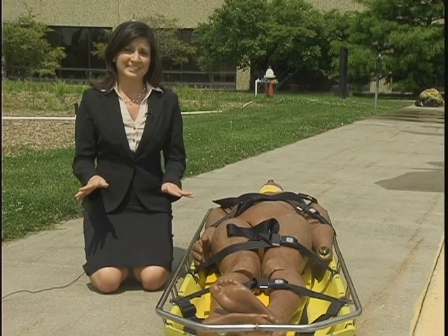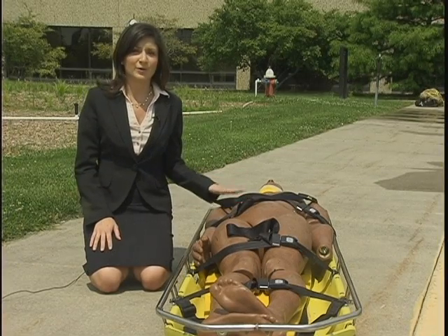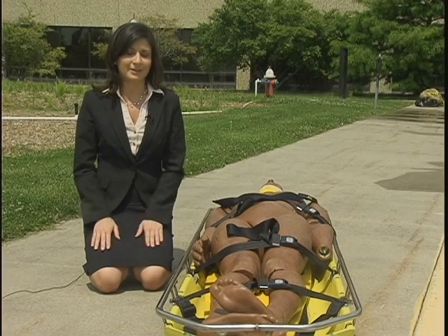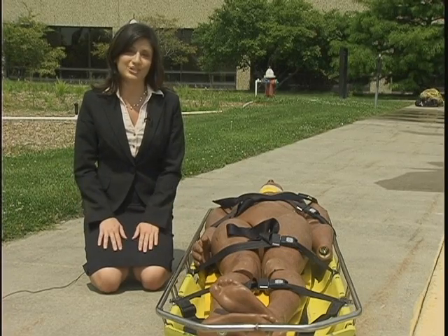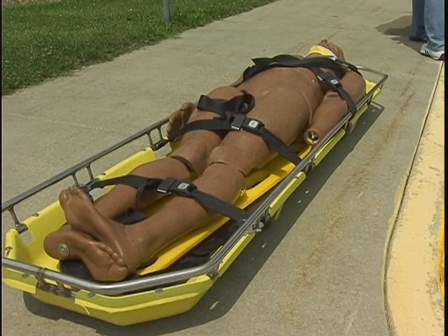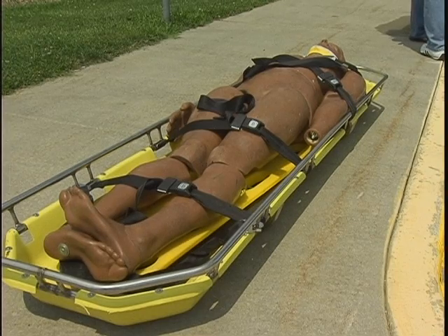One of the exercises today included rescuing this victim from a lab and then bringing him back out here to clean him of any hazardous materials. Now officials say, don't worry, he's going to be just fine. Oh, it went great. We're able to rescue the person in great time, and it would show that we could have an actual rescue with minimal injury, hopefully.